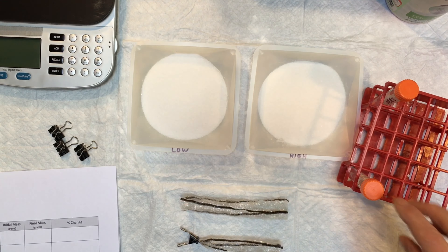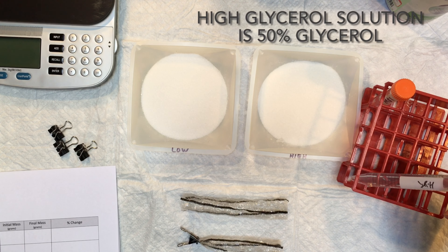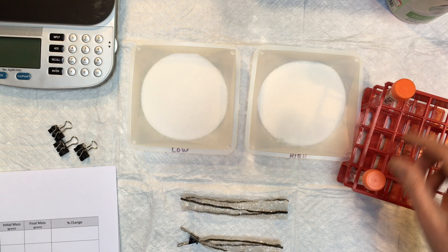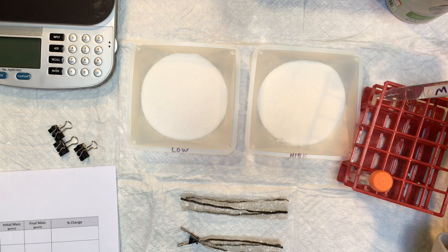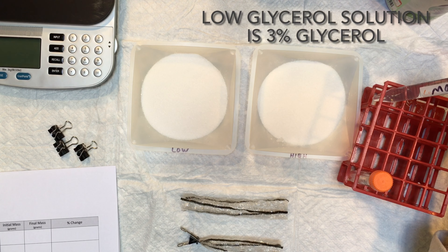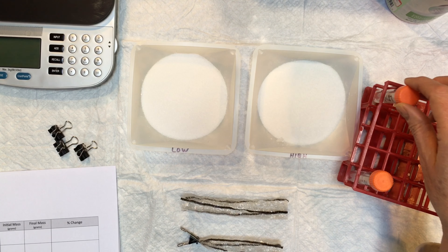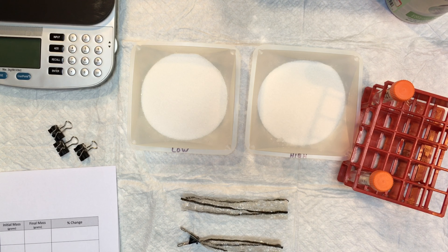We also need two different glycerol solutions. This is a high glycerol solution, which is a 50% glycerol solution, and a low glycerol solution — this is a 3% glycerol. These represent the two types of worms: the wild type and the mutant worms.